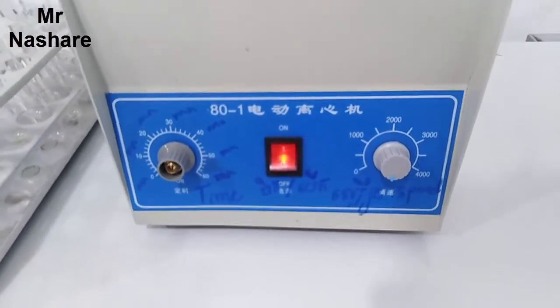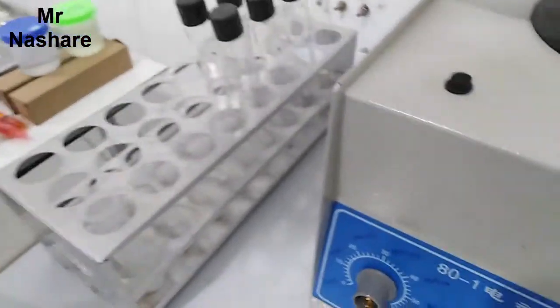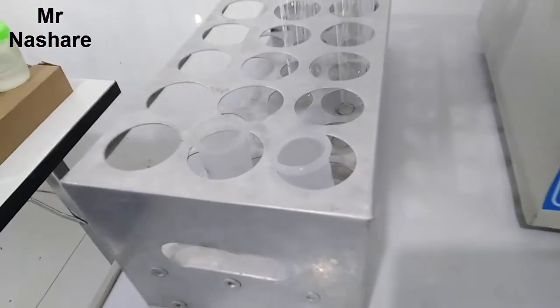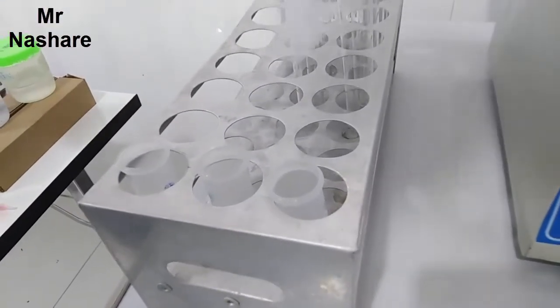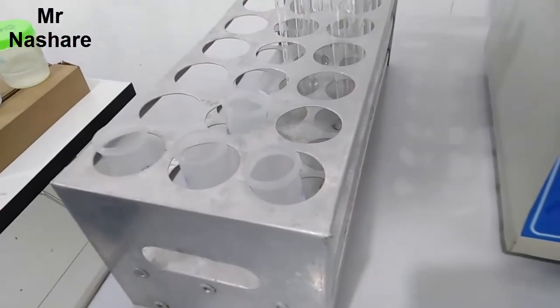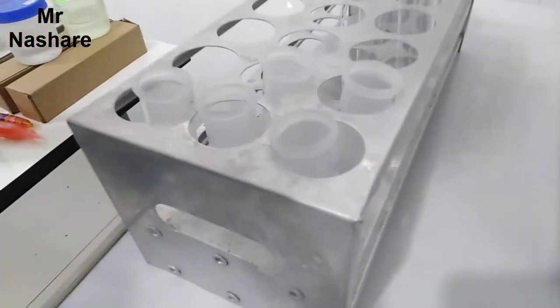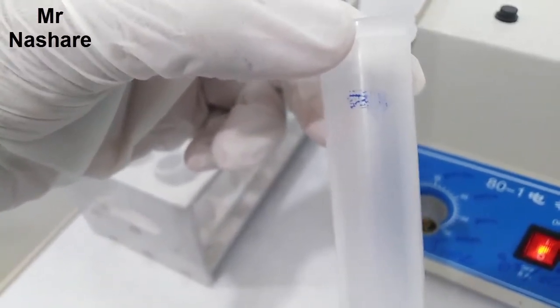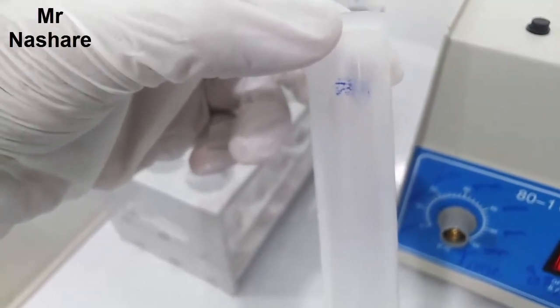Now let's start. Here we take a syringe — you know it holds 20 ml — and then we take the sample into these two tubes.